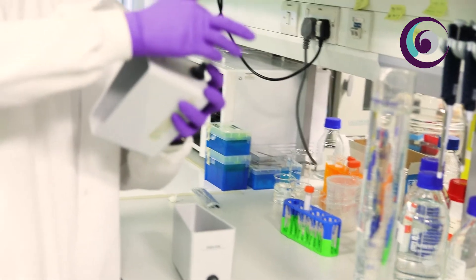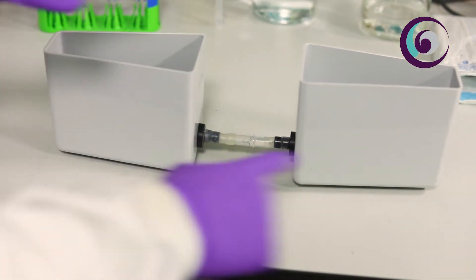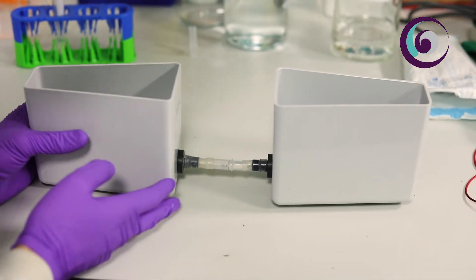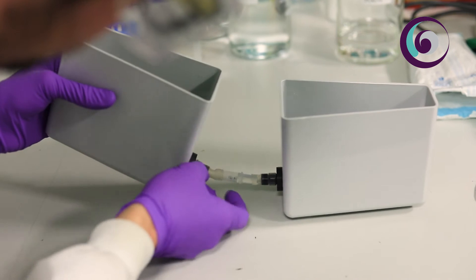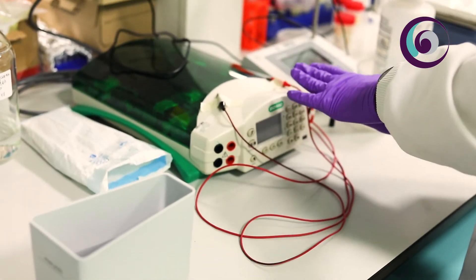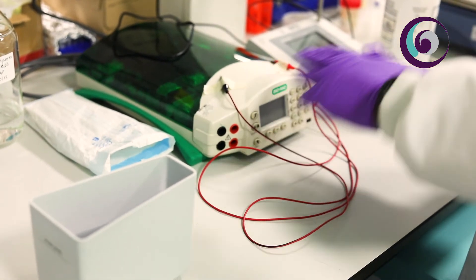As we are using an electric field we need to get rid of any possible leak or any possible loss of electric field and the way that we're losing some field is with air or bubbles. Now we go to close finally the system to start the patterning process.